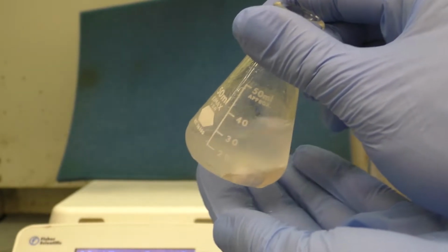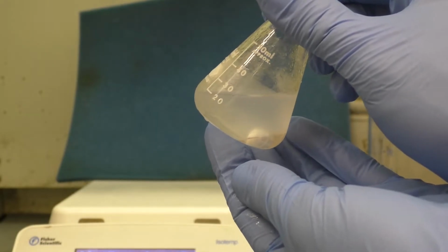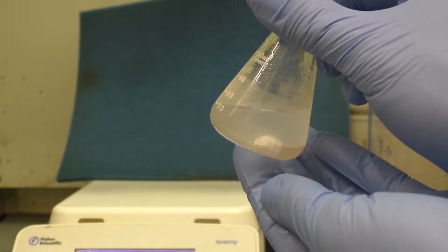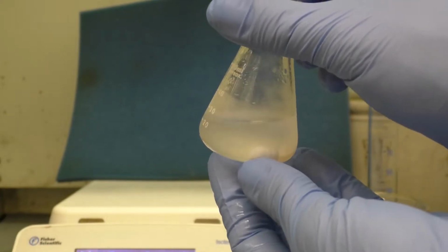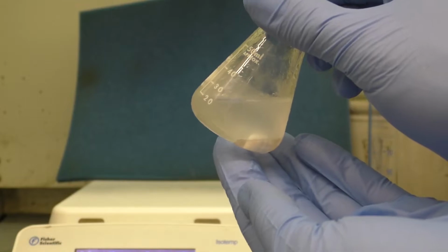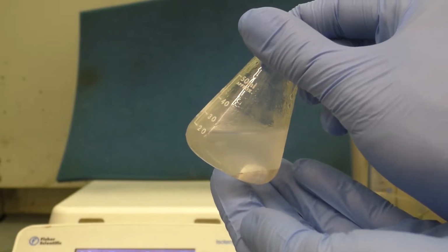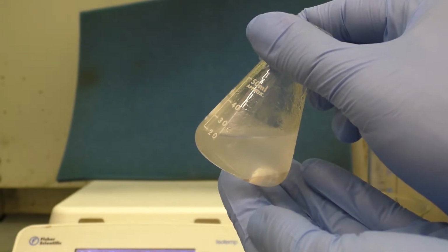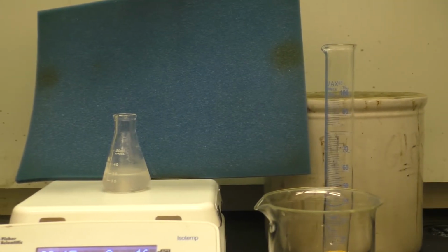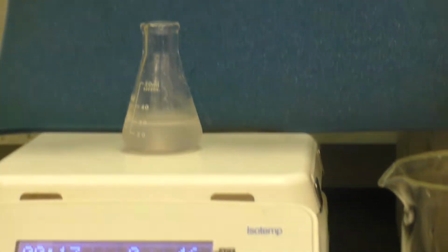crystallize out. So what we can do is we can actually destroy that acetic anhydride simply by heating it back again on the hot plate and causing it to react with water to give you 2 equivalents of acetic acid. This should then remove this kind of immiscible layer, since acetic acid is miscible with water. And then we might have better success crystallizing the material by putting it back in the ice bath and scraping the glass for a little bit. So I'll place this back on the hot plate, and I'll turn the temperature back on and heat this for maybe about 10 to 15 minutes.